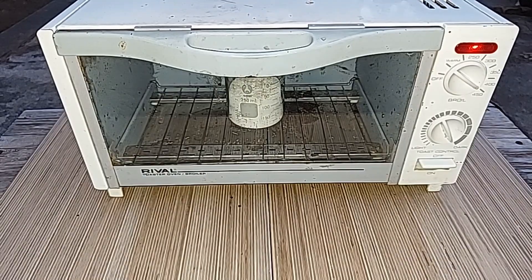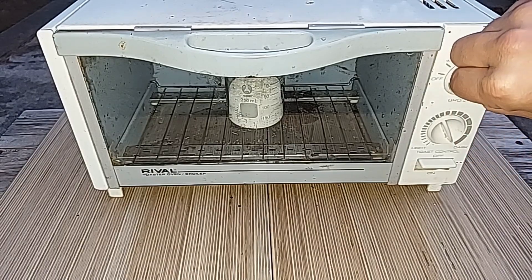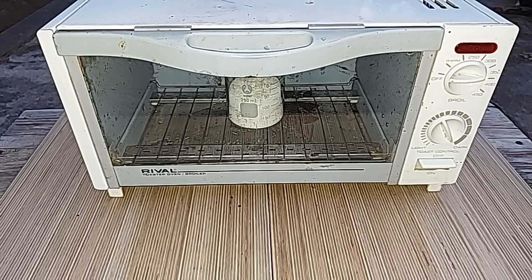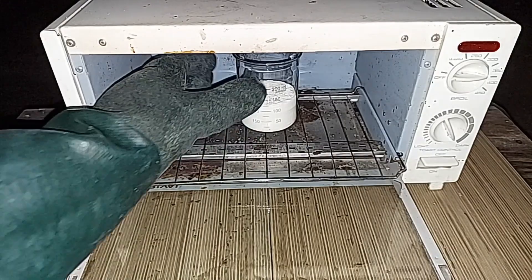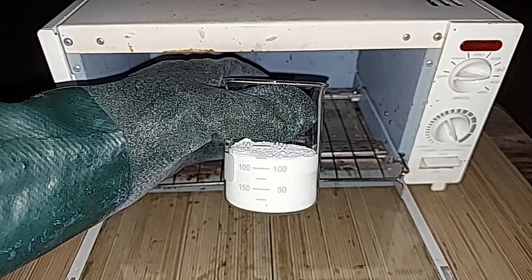Time is up. Turn this down all the way, of course, and now just a matter of waiting for it to cool. It's cooled down enough. I can pick it up with these gloves. I'm going to take it inside, and we'll take a look at it closer and go on to the next step.